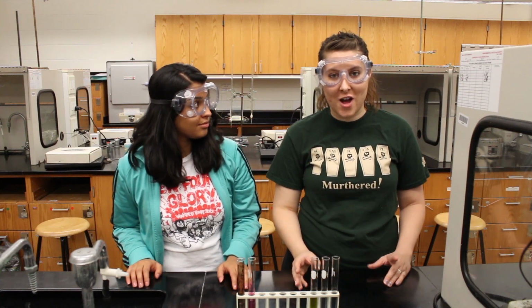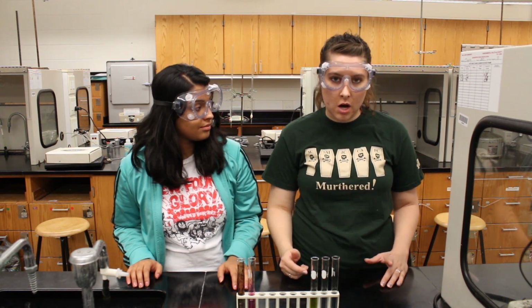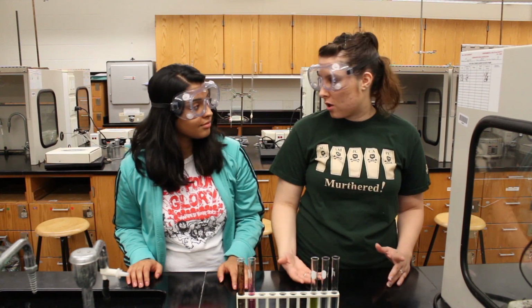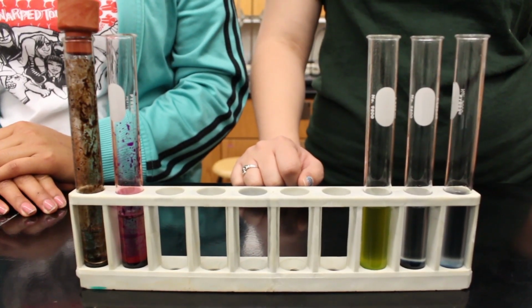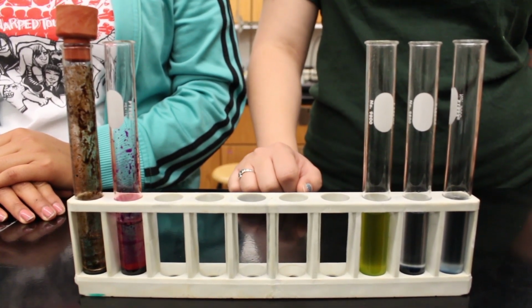In a tertiary alcohol, the carbon attached to the hydroxyl group has 3 other carbons attached, so there's no room for the hydrogen. So we'll be able to tell which alcohol is tertiary by whether or not it undergoes oxidation. And we'll also be able to distinguish primary and secondary alcohols because of the different products.